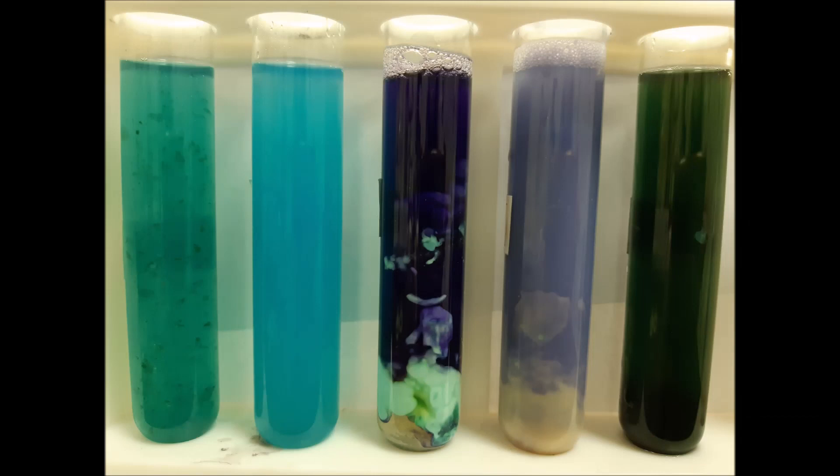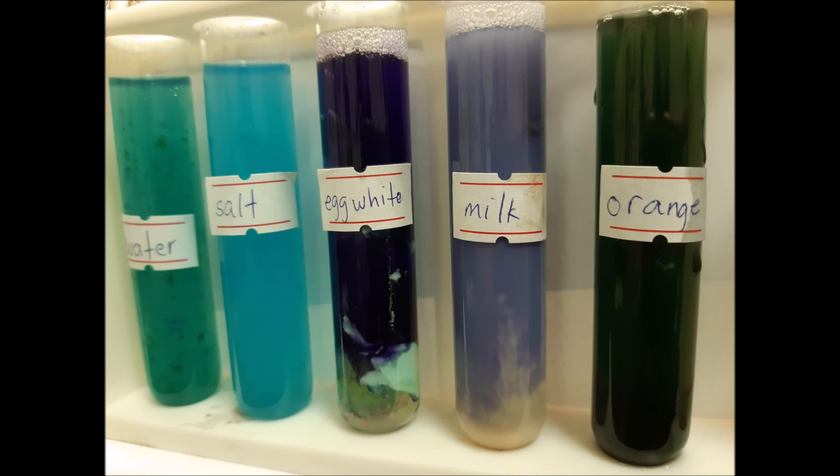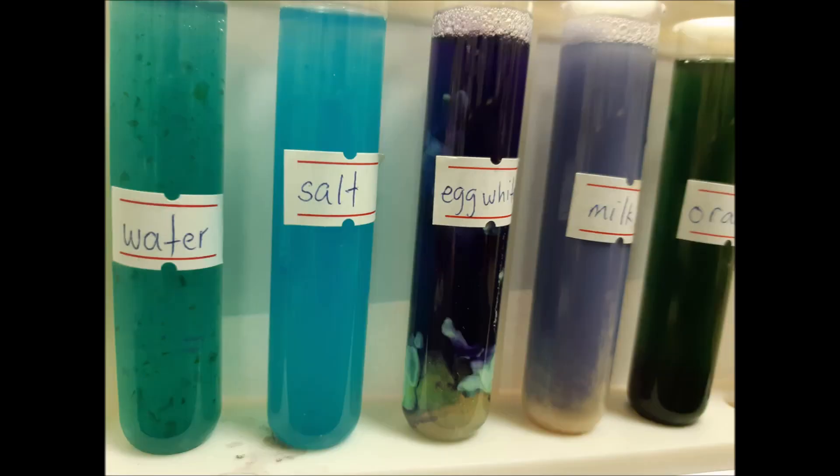I add more liquid so we can see clearly that the egg white and the milk have the purple color. The rest are not purple.